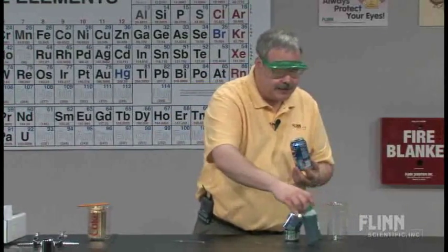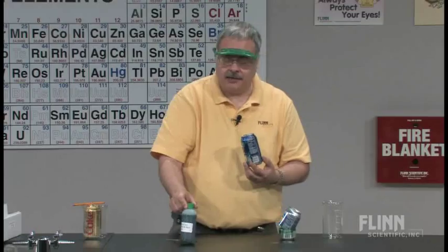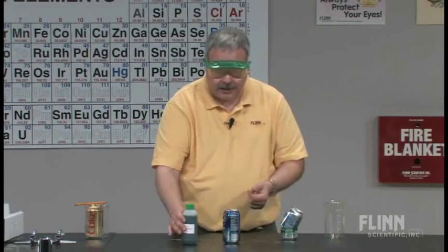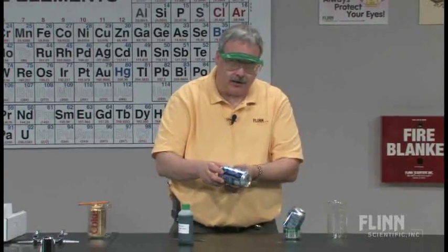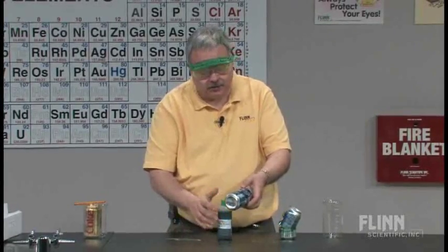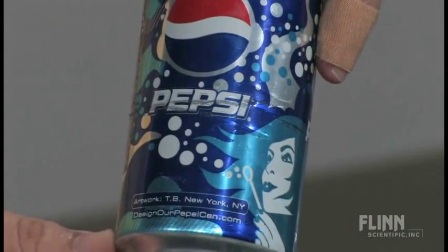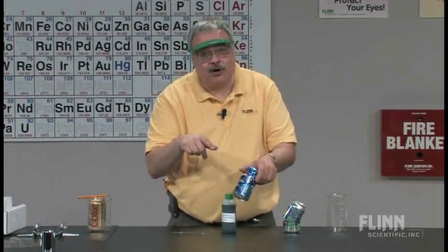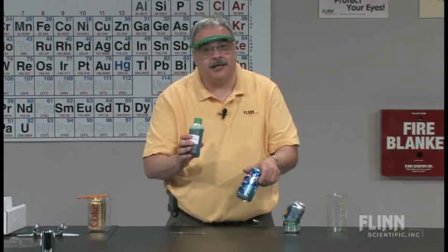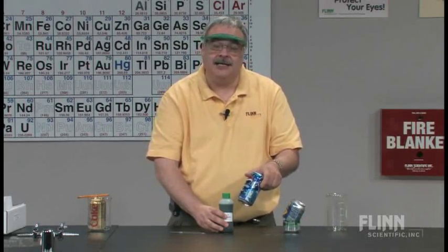Once that's done, what you're going to do is take approximately 3-molar cupric chloride. You want to be cautious about this. Pour it into the can so that it's above where you have scored the mark. You want to be careful about this, otherwise it's going to be too obvious. This is another prepared can where the mark is just at the bottom of the Pepsi. The cupric chloride — the copper ions — are going to start an oxidation-reduction reaction between the copper ions and the aluminum metal.